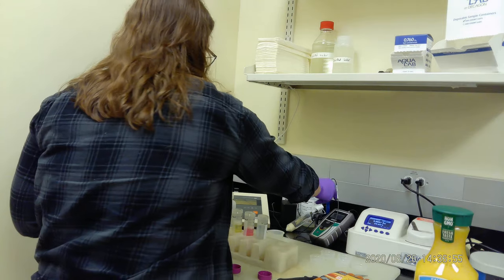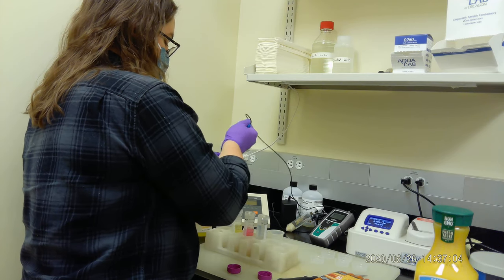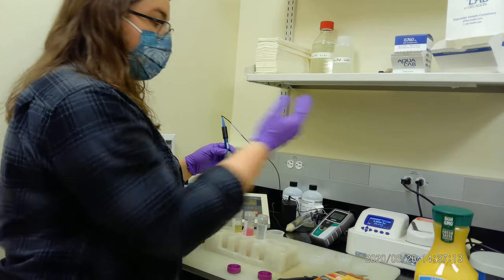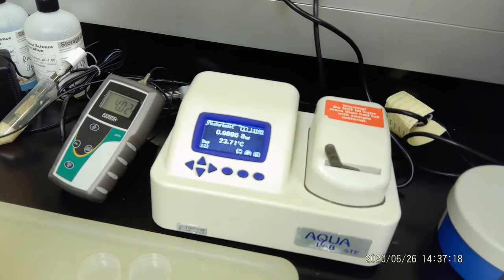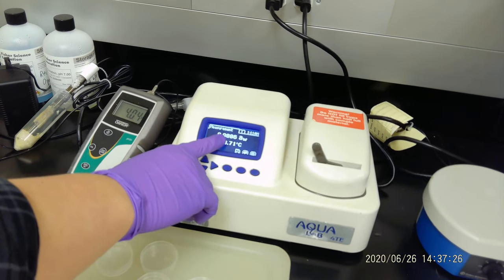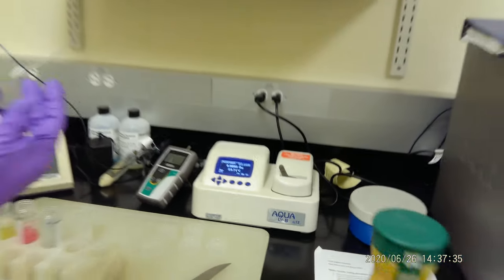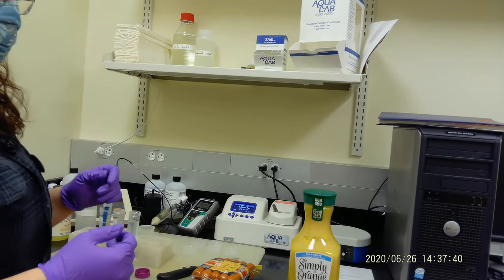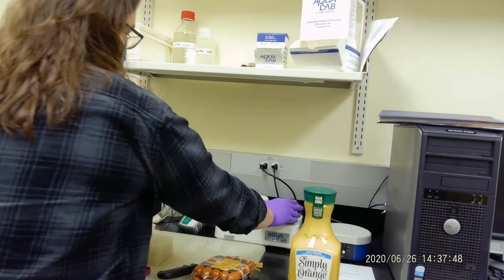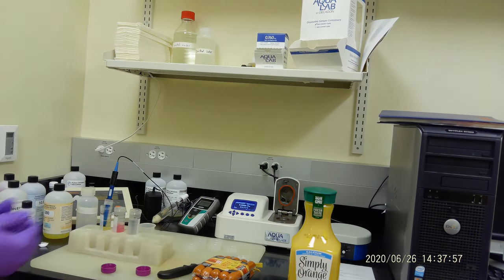So let's do a first example after we calibrate. Let's measure the pH of the juice. Our water activity for distilled water is done. It's giving a water activity of 0.9886, so that is very close to one, and that is what it should be because it is water. It should have very high water activity. But be careful, this is not the final number—this is the measured number. Scientifically, we have to do a calibration, a linear regression model. When you're done, you can just open it up.